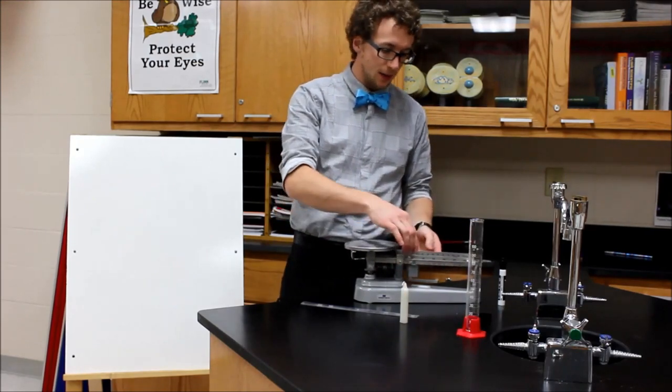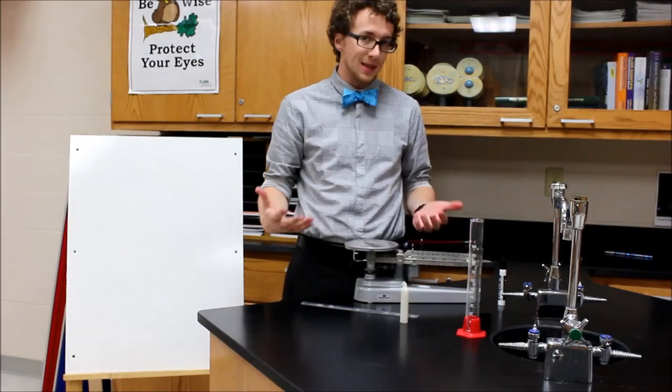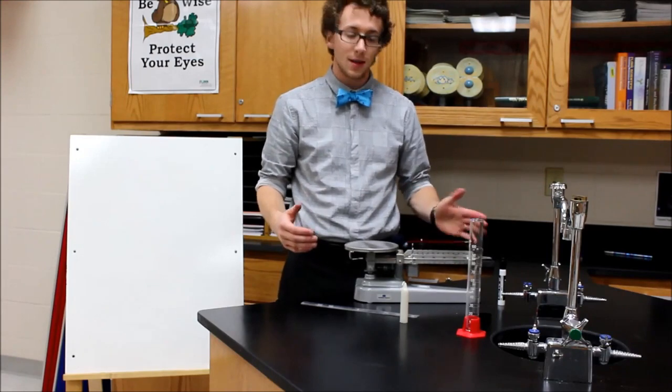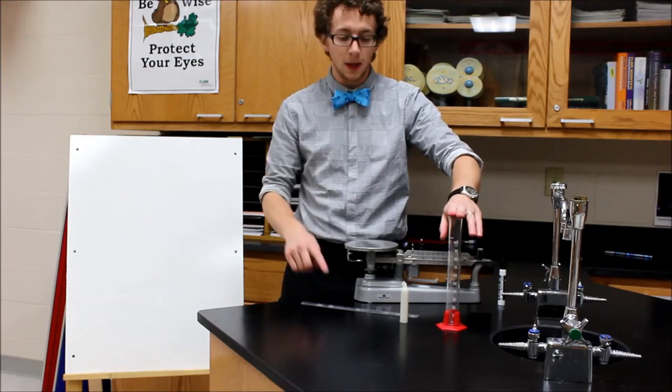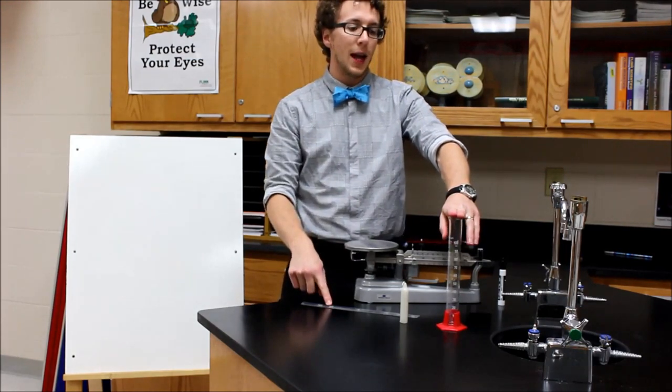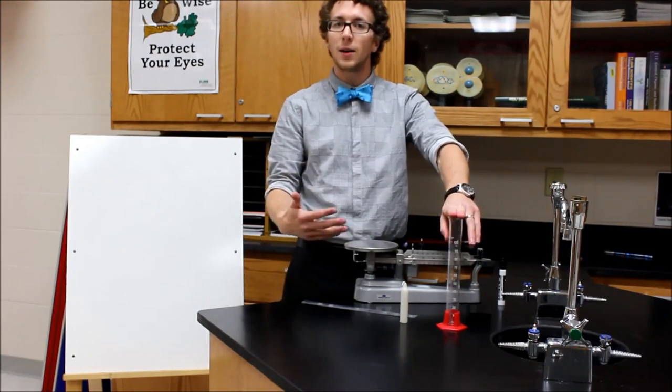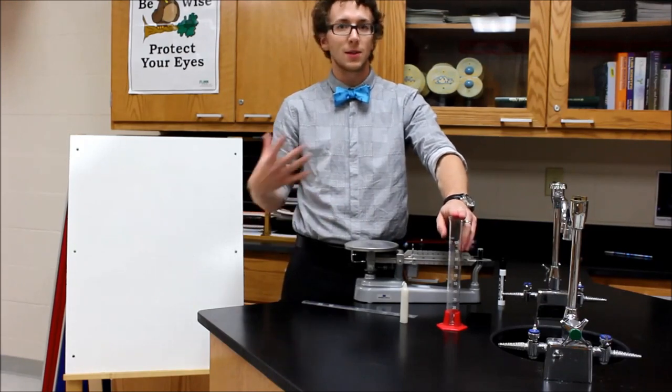That's the one that has these three beams essentially where I can move weights across. I'm going to measure the volume of something two different ways and then we're going to use those two values to calculate density. That's what we're doing in this video.